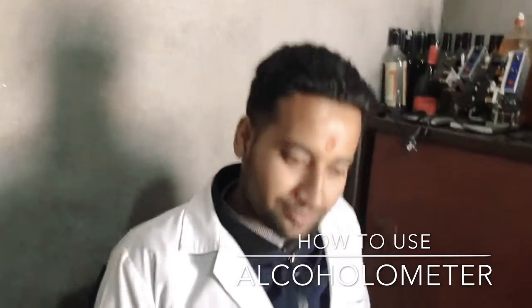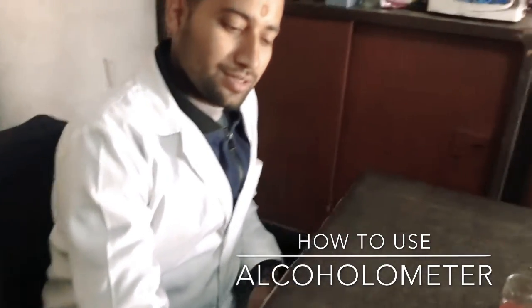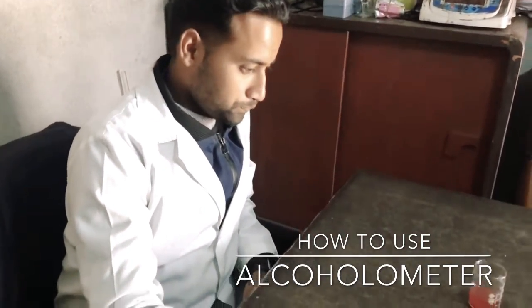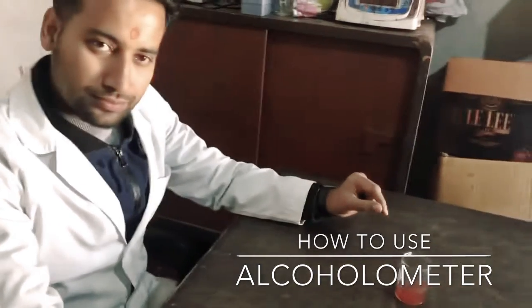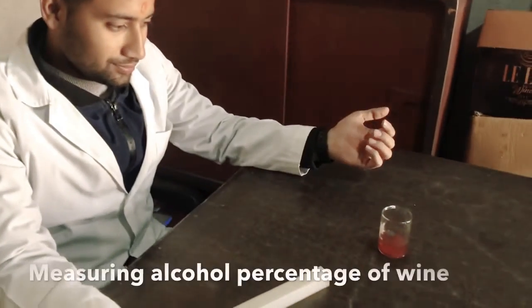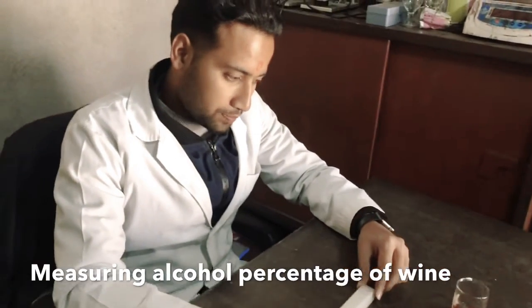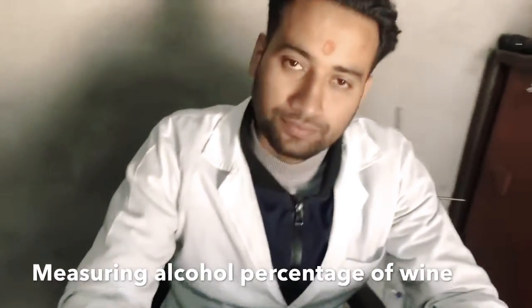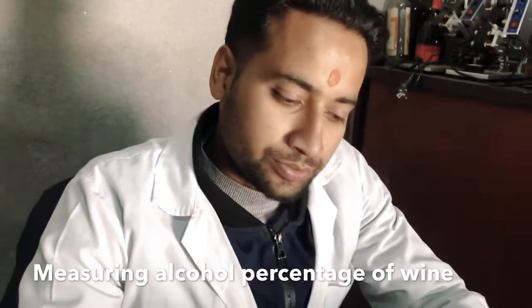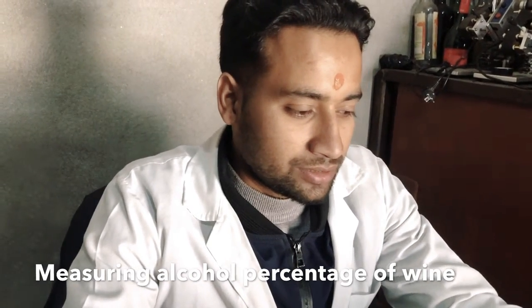I am Mahananda Pandey and here is Apil Pogheni. I am Apil Pogheni. Apil is going to demonstrate today about how we can measure the alcohol percentage in a beverage. Today we are going to demonstrate in terms of wines how we can determine the alcohol percentage in wine. We are going to determine the alcohol percentage in beverages.